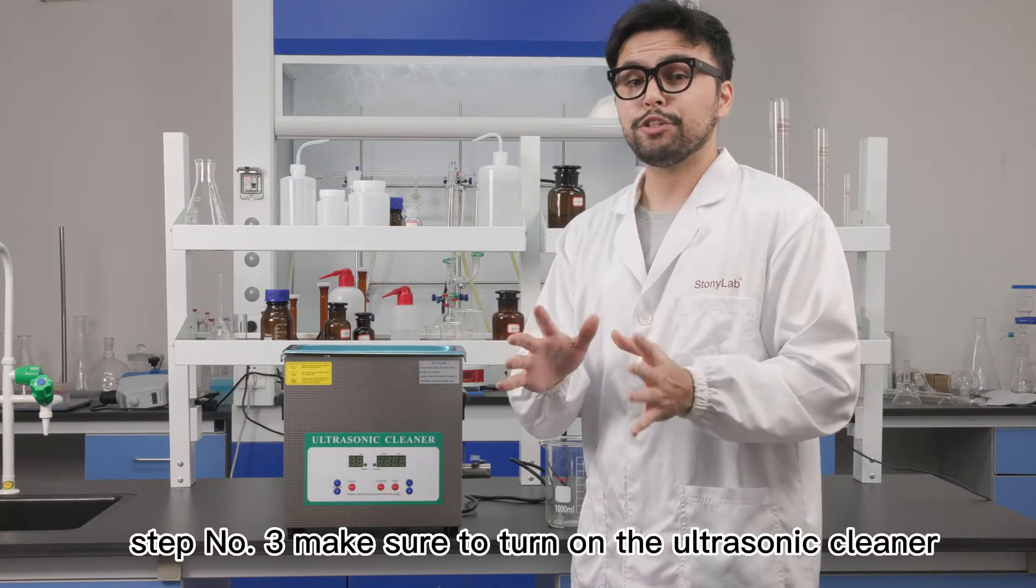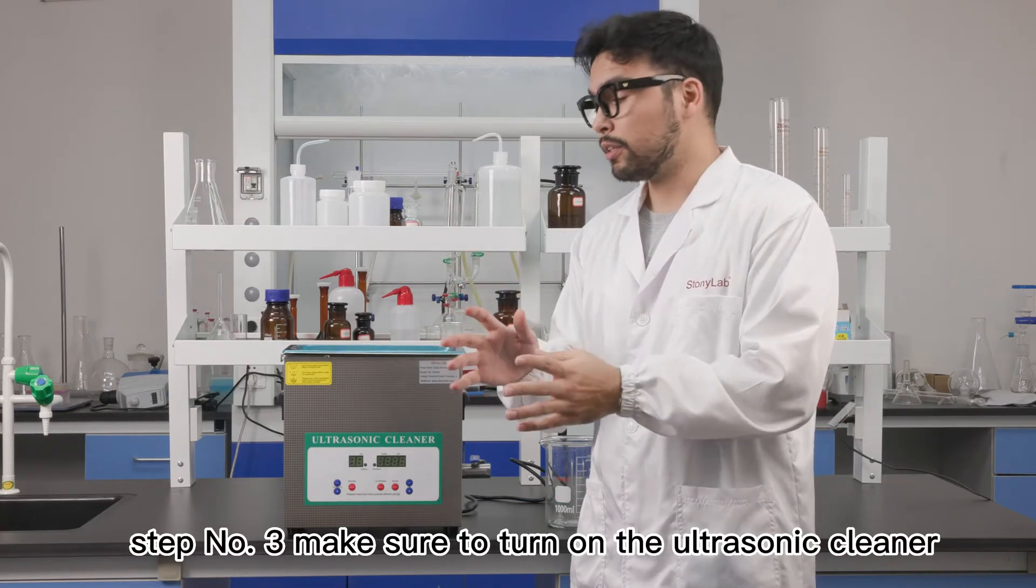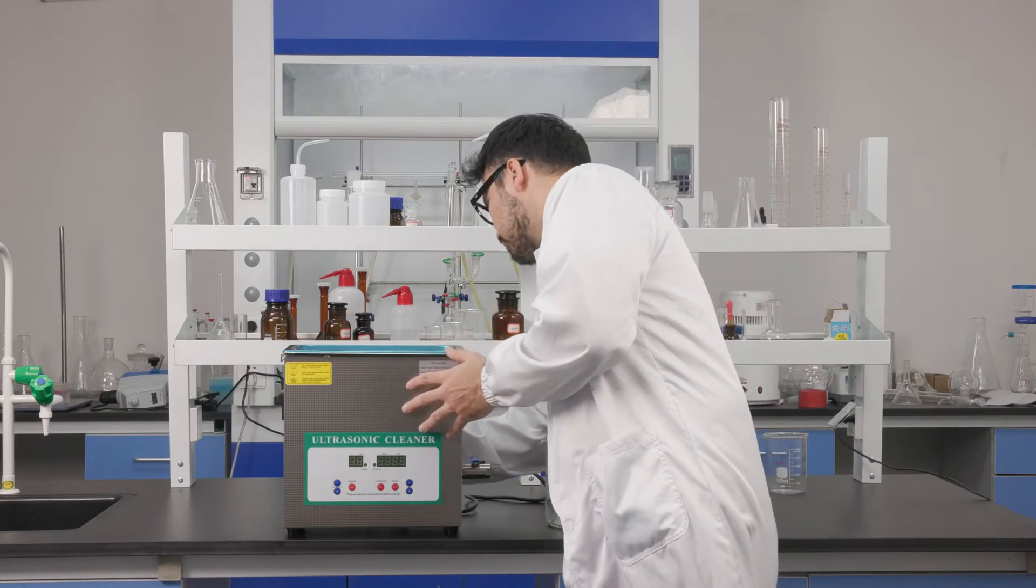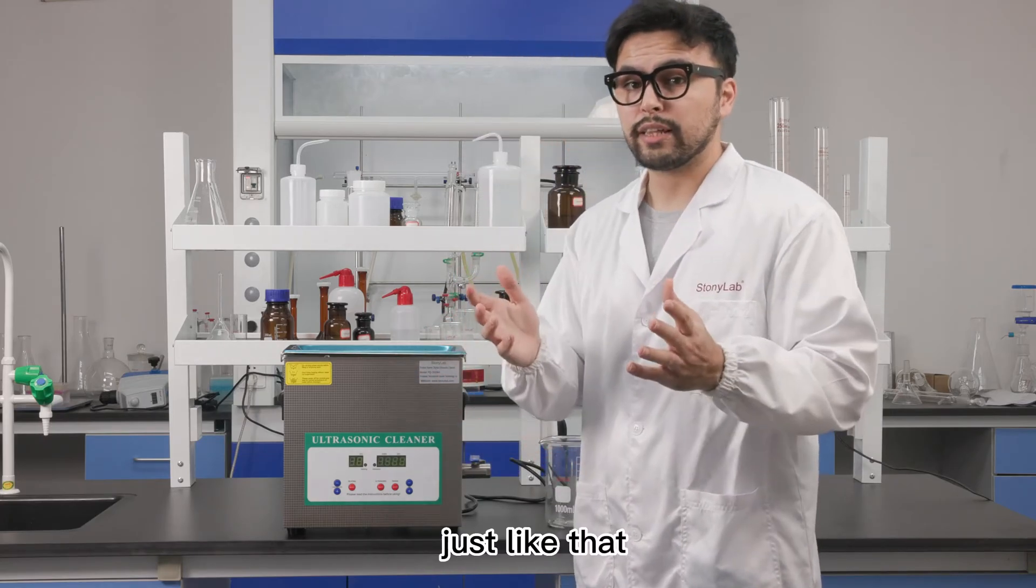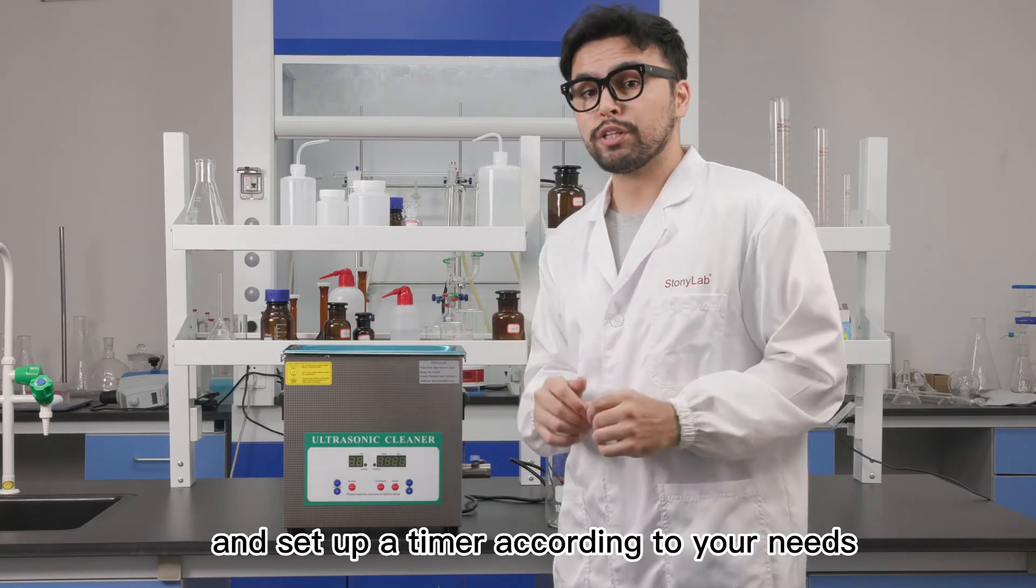Step number three, make sure to turn on the ultrasonic cleaner. The button is behind. Just like that. And set up the timer according to your needs.